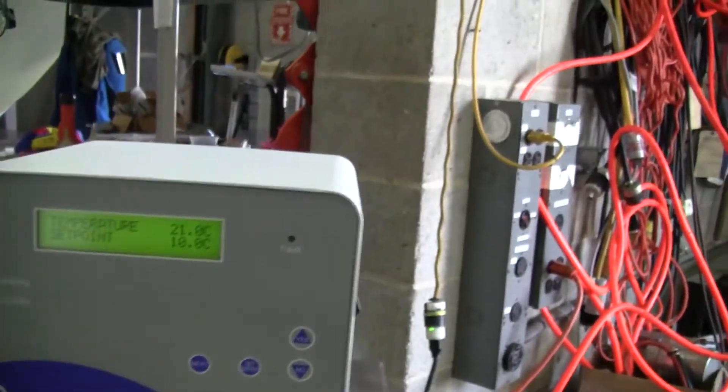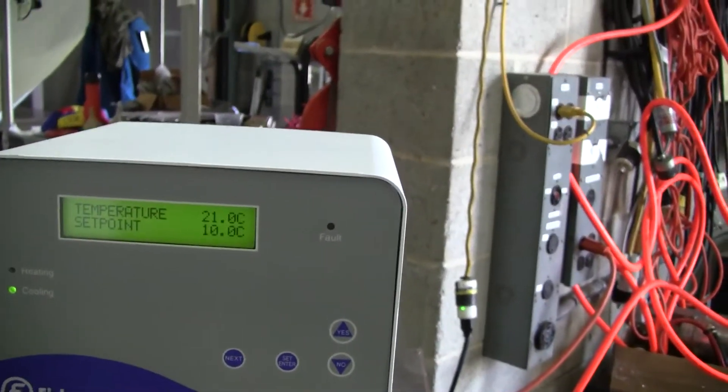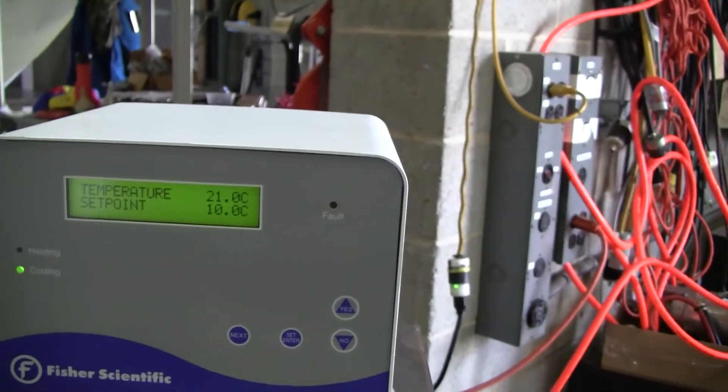Currently it's cooling, set point of 10 degrees C. It's down to 21 at this moment. It's been going down.